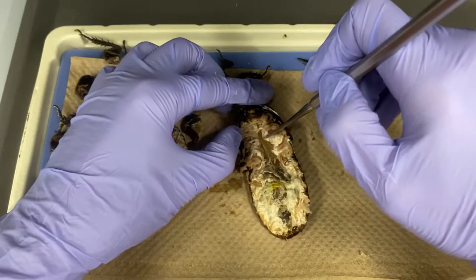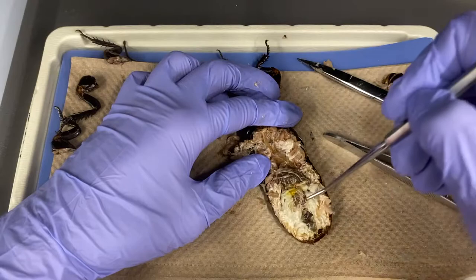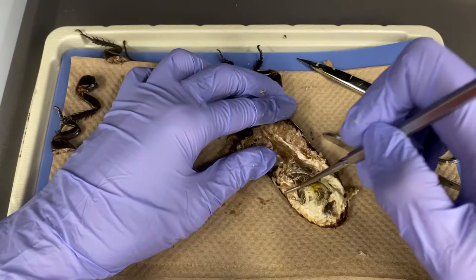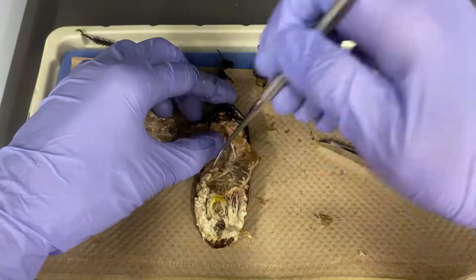The esophagus can be found near the head. Once it has been identified, the tube of the digestive tract can be followed all the way to the anus. Using a bent probe, the fat bodies around the digestive tract can now be carefully removed. With your probe, tease apart the coiled digestive tract.